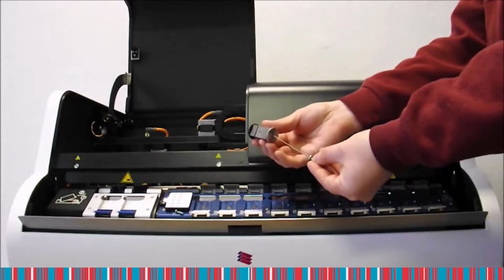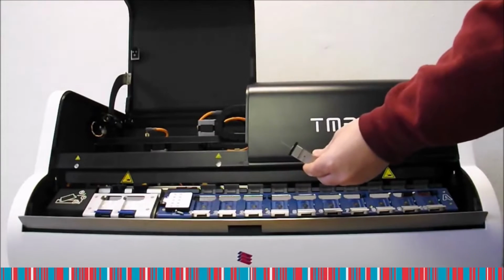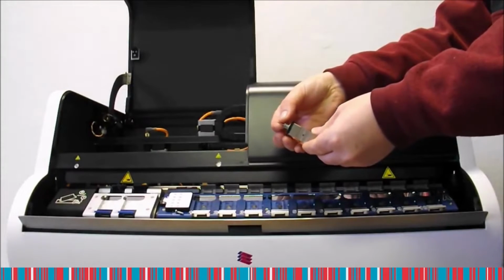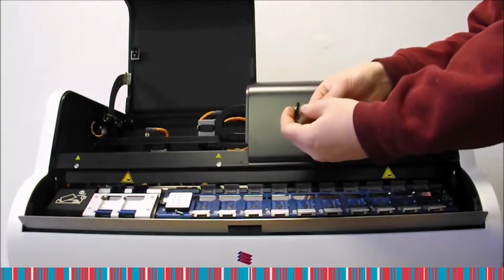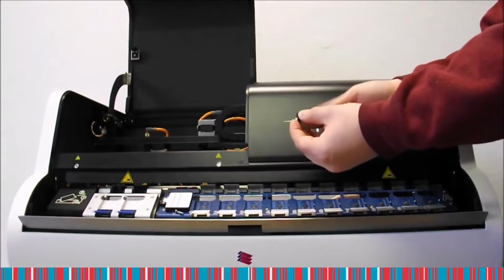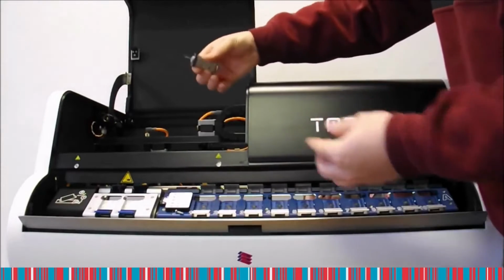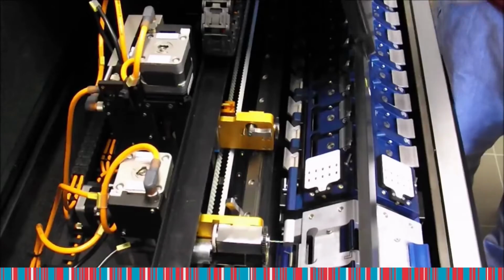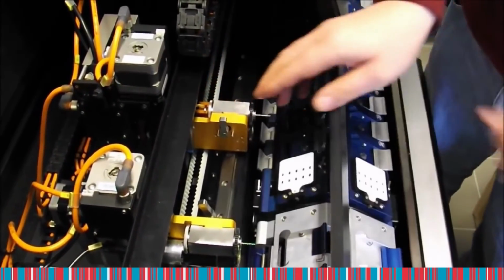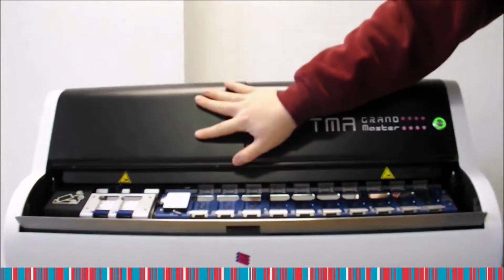Insert a piston in the puncher chuck. When the piston is in its place, you can insert the puncher as well. If the puncher is inserted in the chuck, you need to tighten it just like previously in the case of the driller. If you feel that the puncher is fixed well, you can insert the chuck in the machine. When the chuck is in its place, fix it with a lever. Now you may close the tool change compartment door.